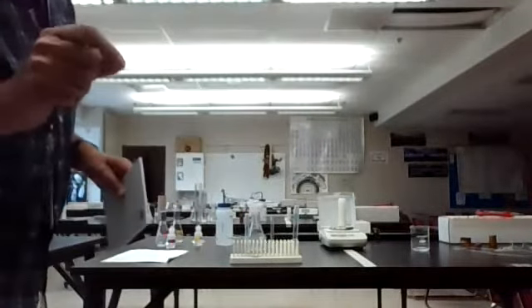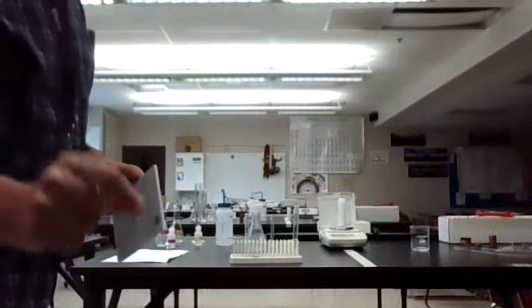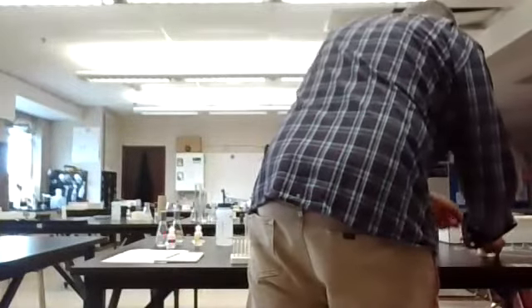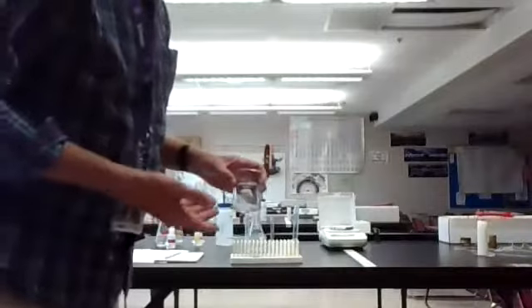If you see mass being lost ever, that should be indicative of a chemical reaction. A physical reaction should be on the opposite end, and I think, yes. Take this off here. My ice cube is now melted, and you can see no ice cube left. There's just water. I can find the mass of this also.